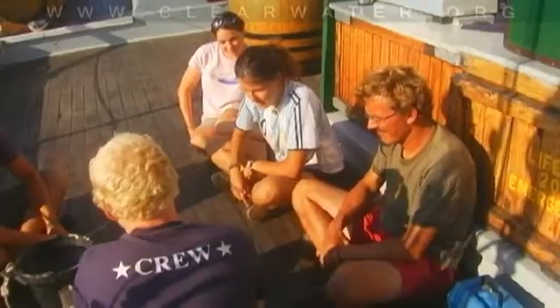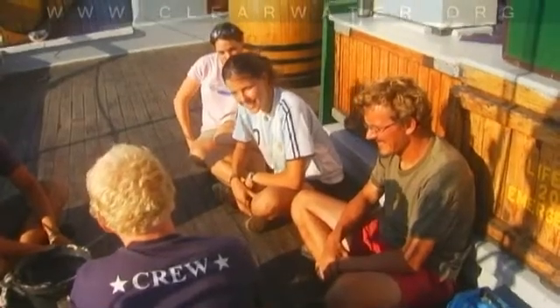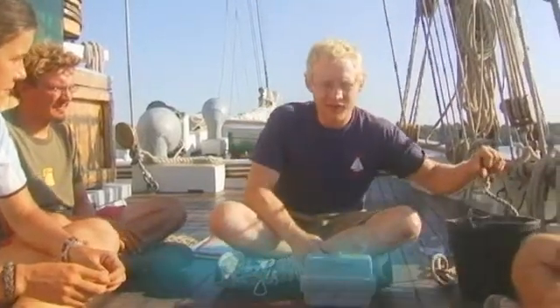Salinity is the measurement of how salty the water is. Why would that be important? For what kinds of animals live in the water? Because some fish like fresh water and some like salt water. So let's measure salinity first.